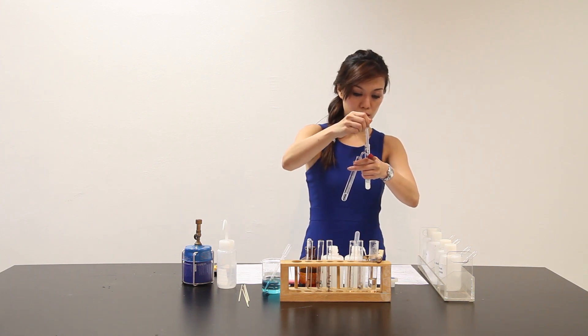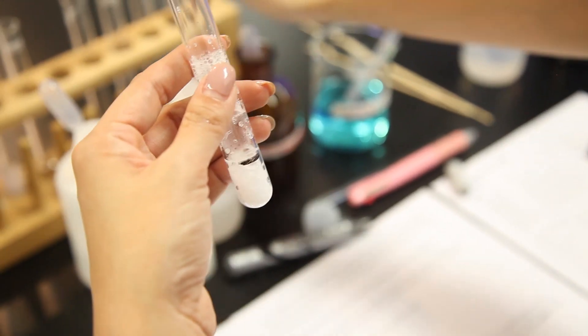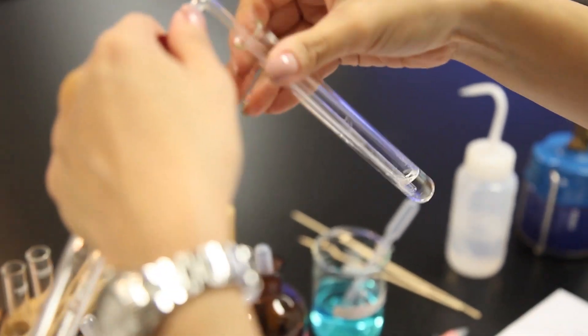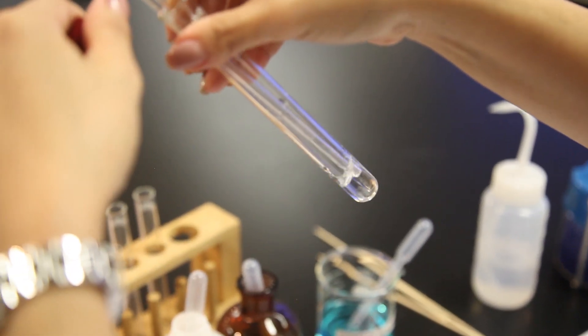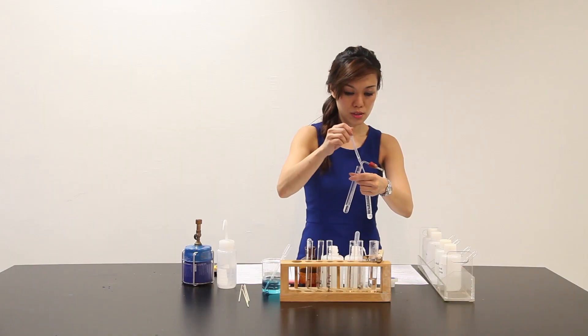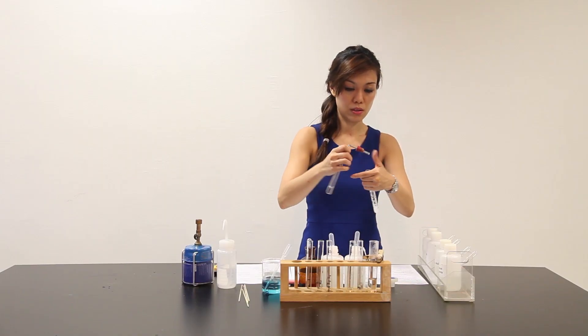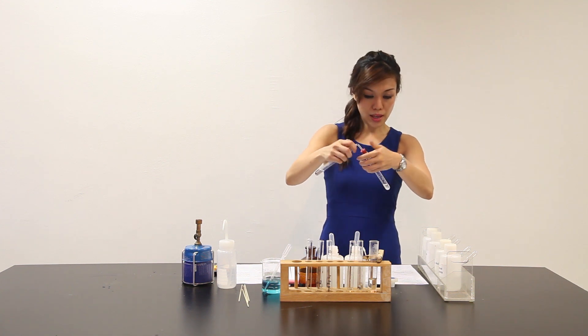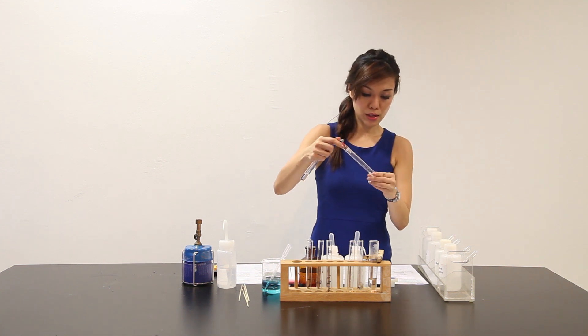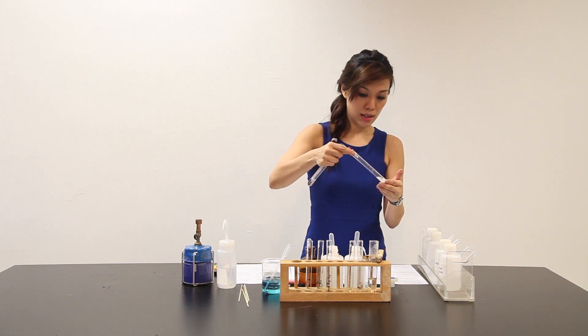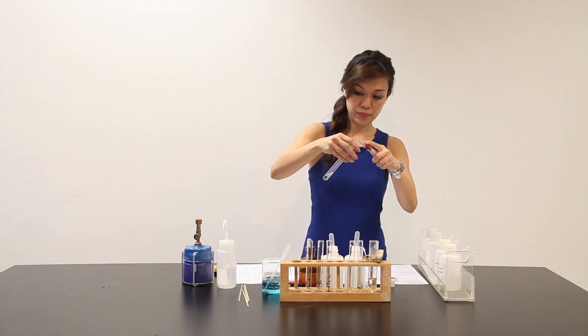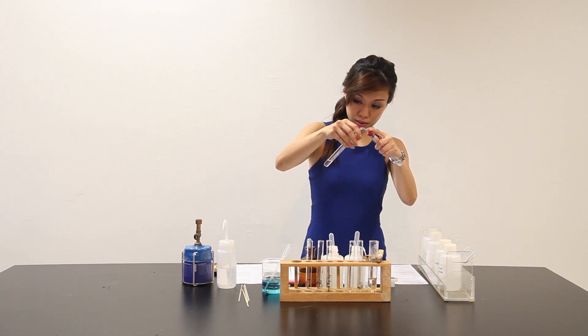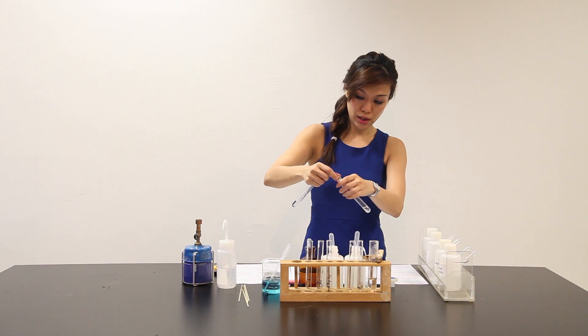Now, let me add the HCl to it. Very quickly, bubbles is evolved. Let me quickly insert this. I can add some more acid to this. I can see over here that solid X dissolves inside in the acid, giving a clear solution. Bubbles is evolved. Bubbles evolved cause the lime water to give a white precipitate.